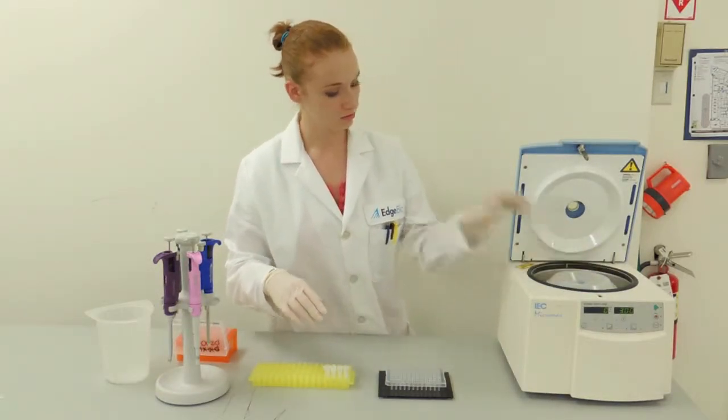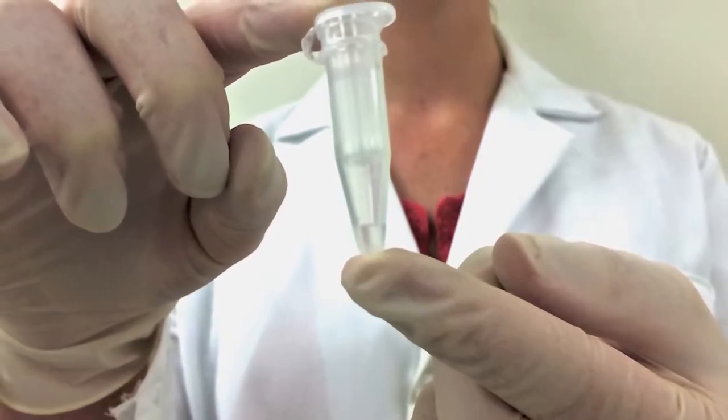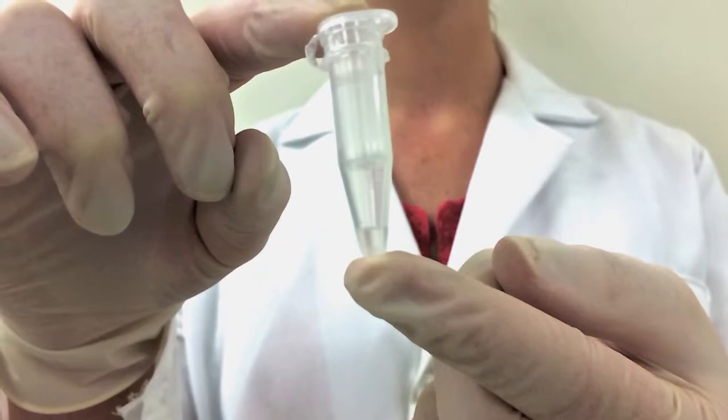After the second spin, you have obtained a purified sample that is ready for sequencing. No further cleanup methods are necessary.